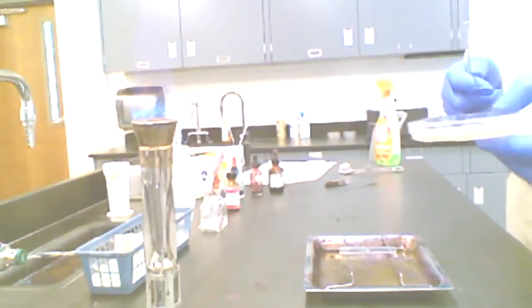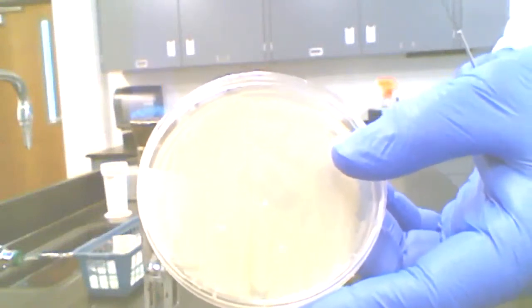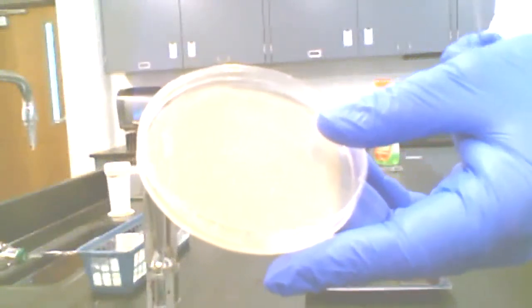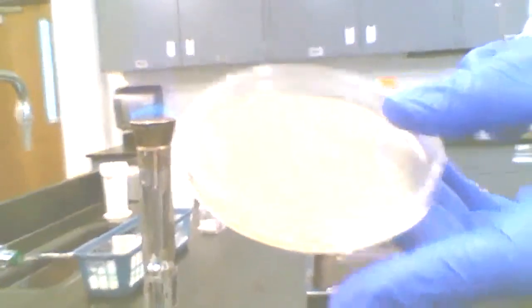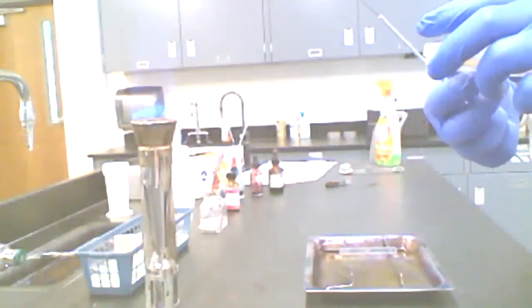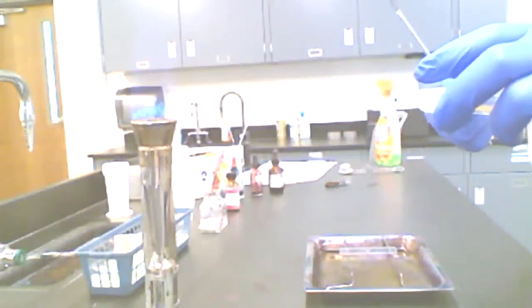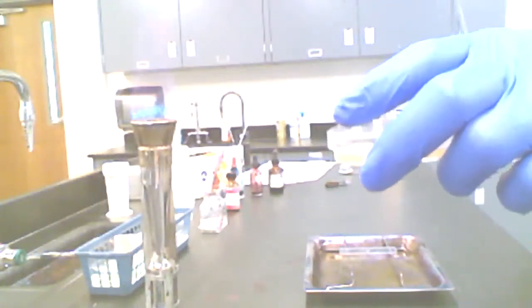So the next thing I'm going to do, I have an organism here. This is an actual plate of a gelatin-like medium called agar, spelled A-G-A-R. There's some nutrients that have been added to it. This is the standard semi-solid medium that we use for plating organisms. And this one has a culture of Bacillus subtilis. That genus is composed of organisms that are rod-shaped. They're elongated. We'll talk more about that later. And they are gram-positive. We'll talk about what that means. But this is a very, very commonly used laboratory organism.